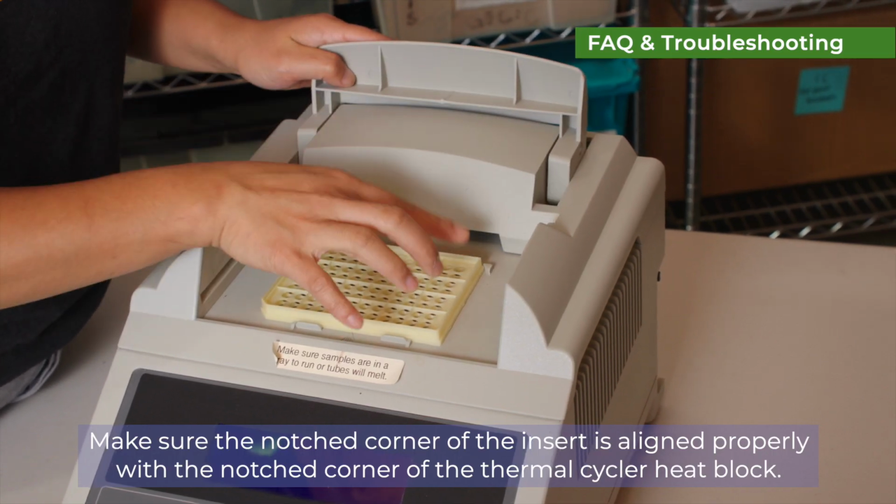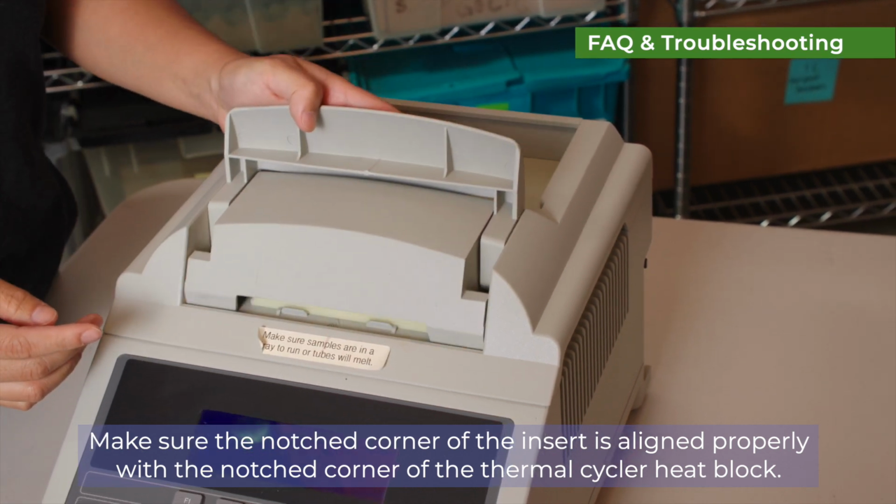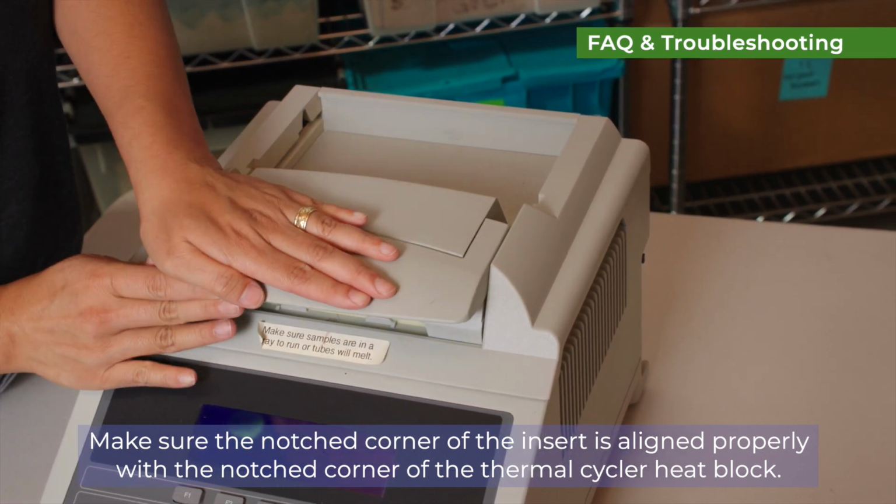If you are unable to slide the thermocycler's carriage forward, make sure the notched corner of the insert is aligned properly with the notched corner of the thermocycler heat block.